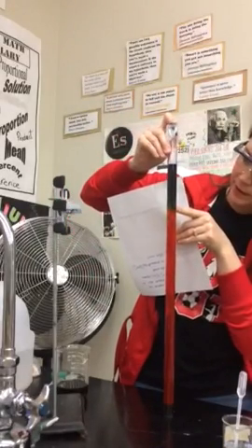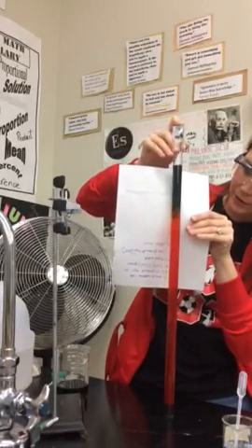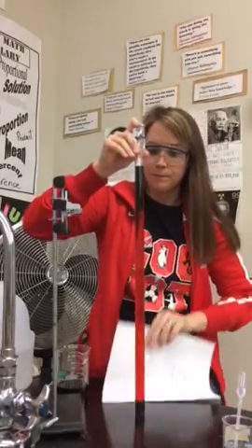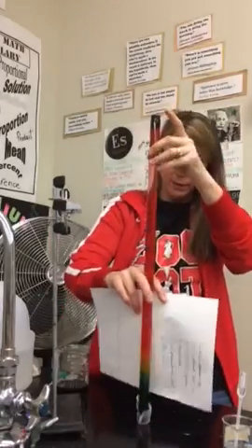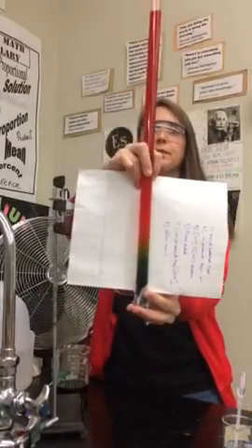If you could look right here, you should be able to see, oh, we got a little bit of a rainbow going on here. And so you should see a green color. There's the rainbow. And now we got our rainbow down here. So you should be able to see the rainbow down there.